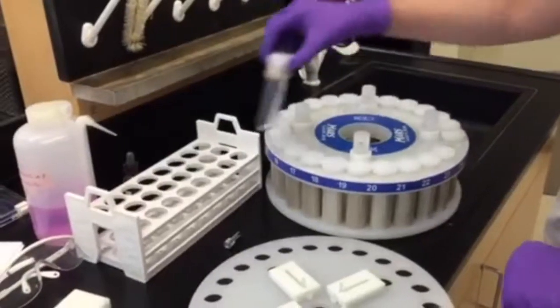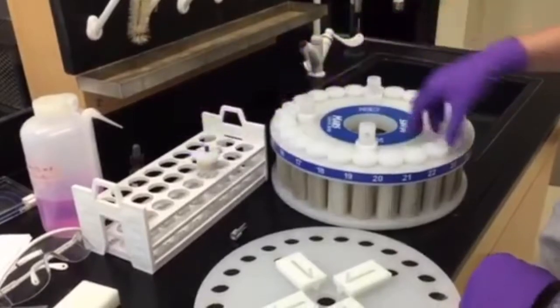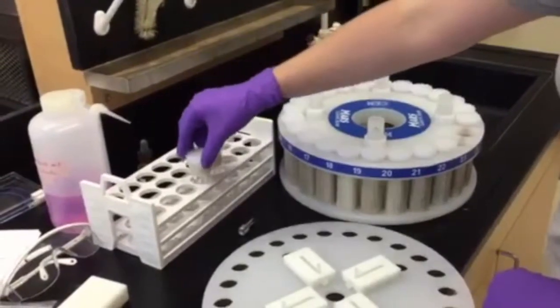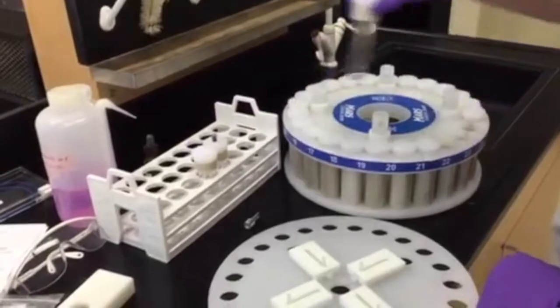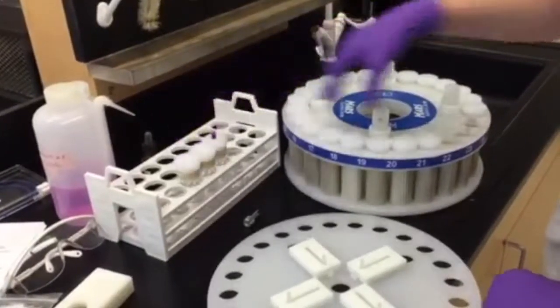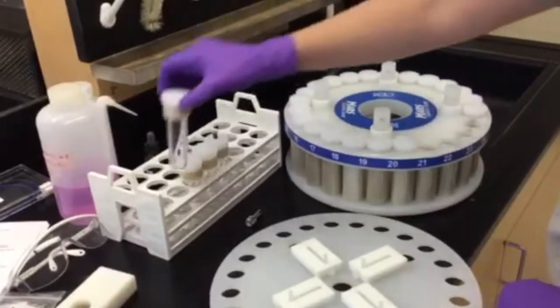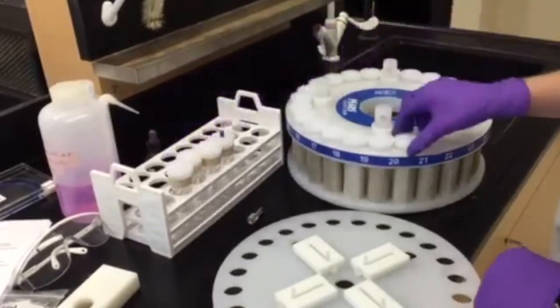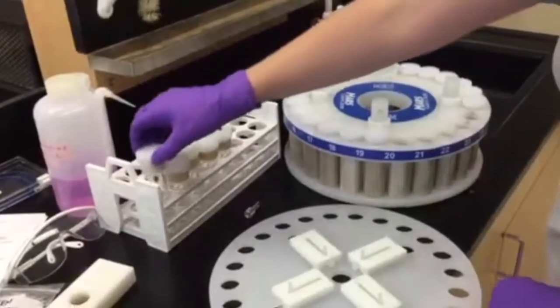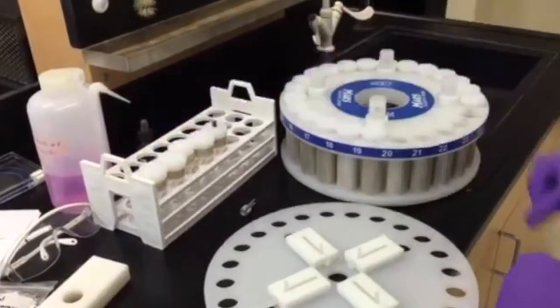In order to perform a reaction, we must prepare the vessels. In this video, four vessels will be used as samples and one will be used as a control. The control vessel will be provided by your instructor. Do not disassemble this vessel since a specific tightness must be applied in order for the experiment to go correctly.